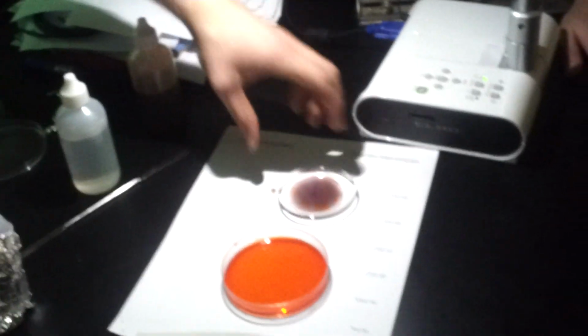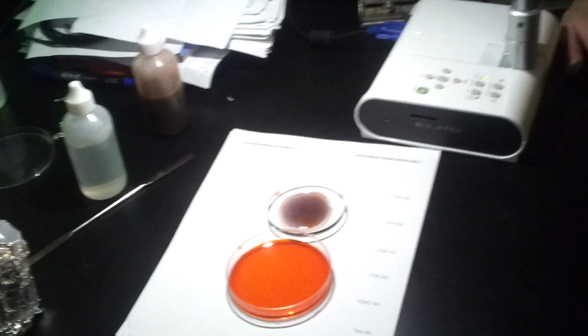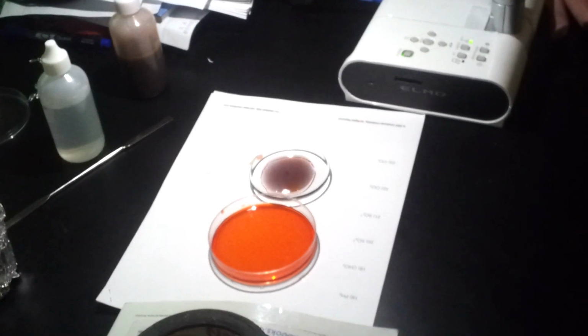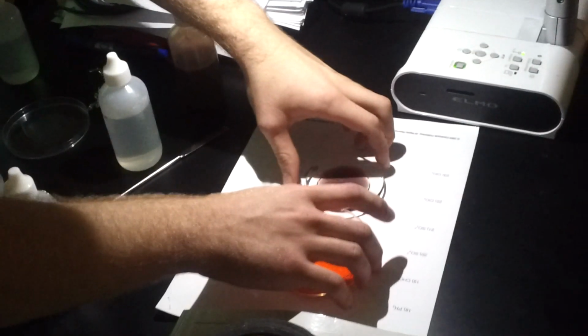Sometimes it takes a little bit to get going, but let's try to get this one in the center so you can take a look at what's going on there. Yeah, that one's turning grayish blue. If you notice, you'll see little rings start to form and just spread out from over there, but let's get it right in the center, and I'll just get this off screen and try to get this to work.